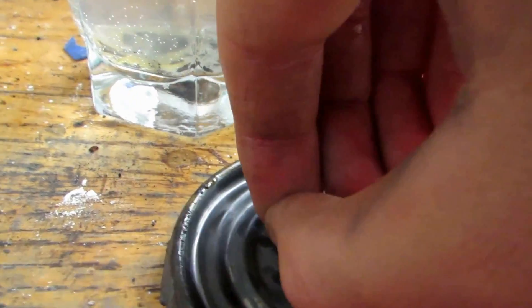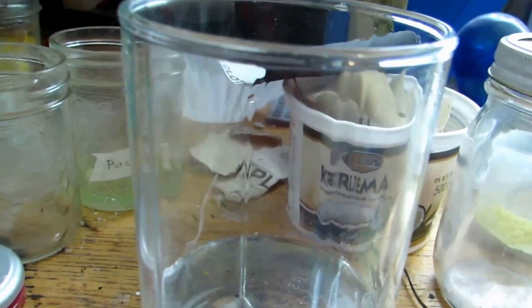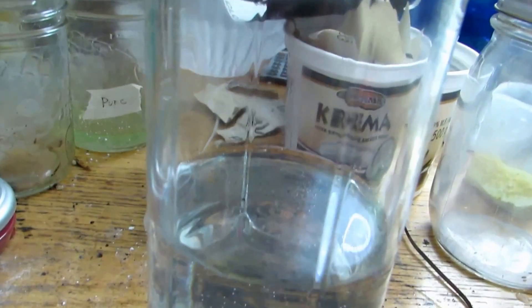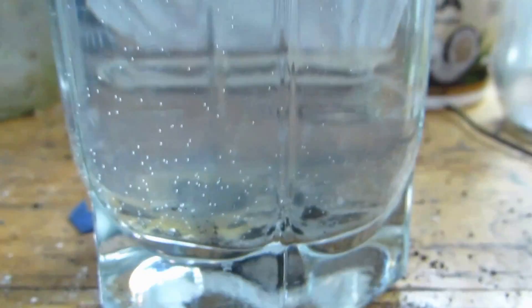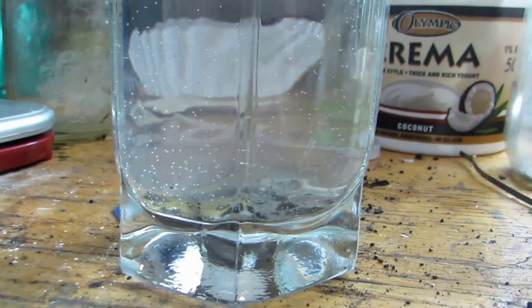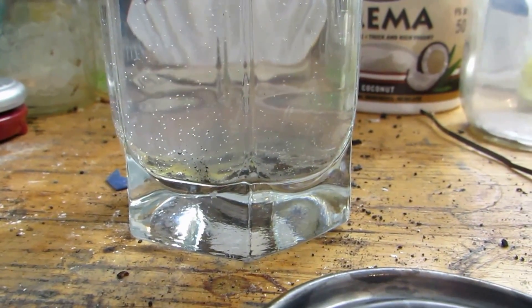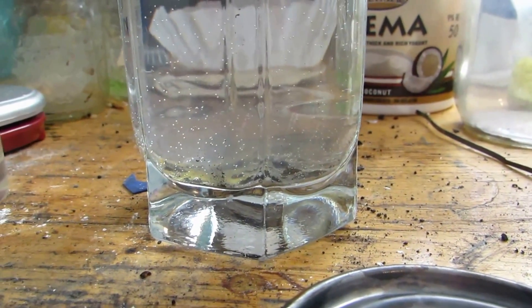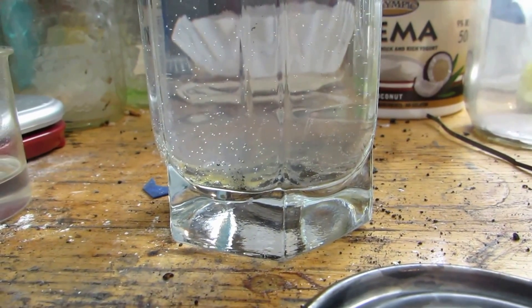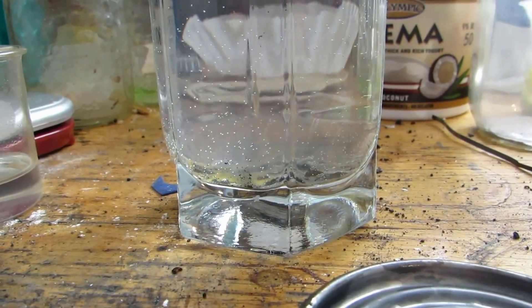This, I'm just going to show you the reactivity of it in this water here. So if we drop it down, we should be able to get a little stream of bubbles coming shortly. First the mineral oil has to come off of it because I did keep it under mineral oil for a bit. So I'll be back once it starts fizzing after I swirled the solution to get the mineral oil off.